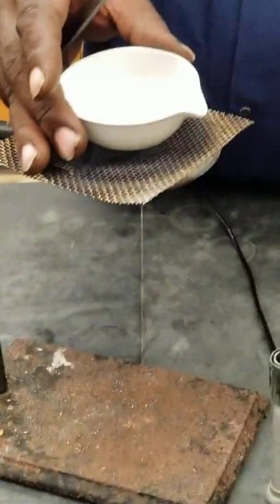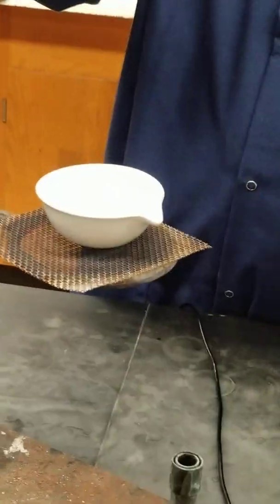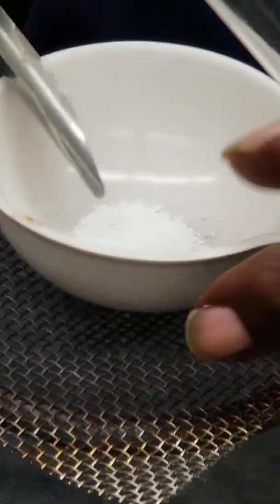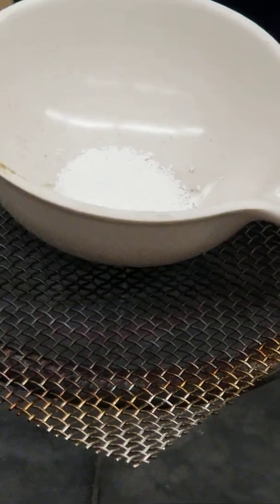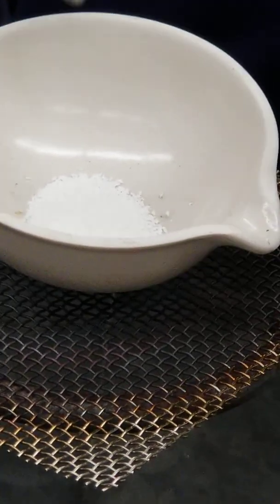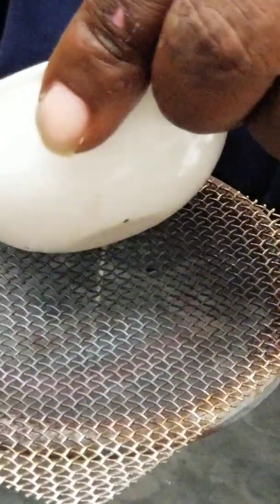The residue, after they're drying out — driving out of the water — there is a residue. And so I'm going to get a little bit. I kind of let it cool here so I can do this touching.